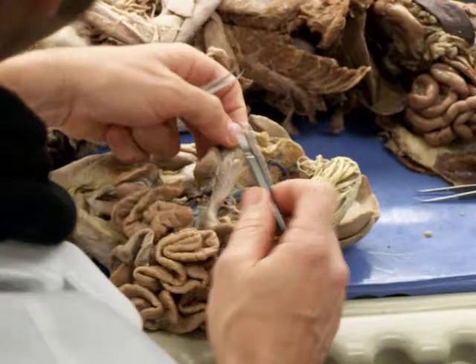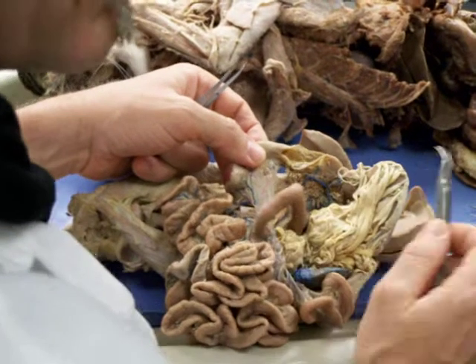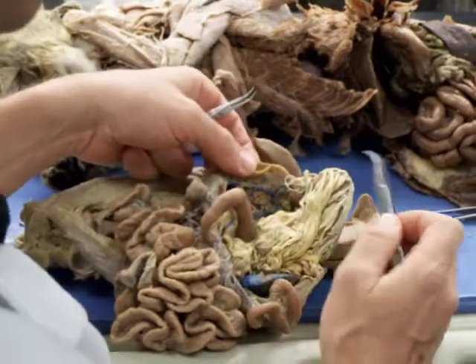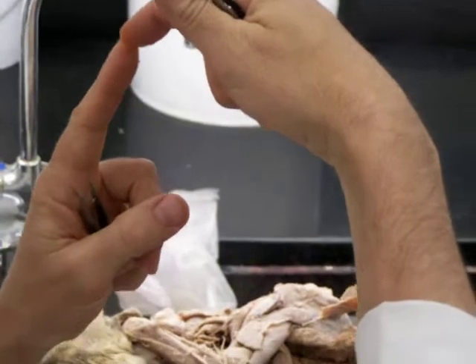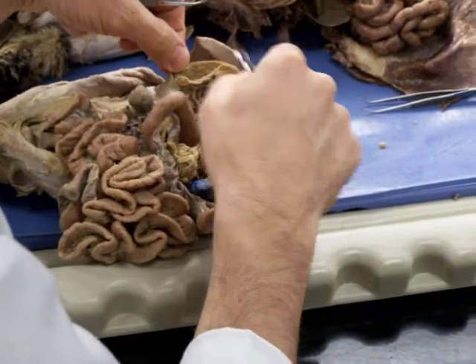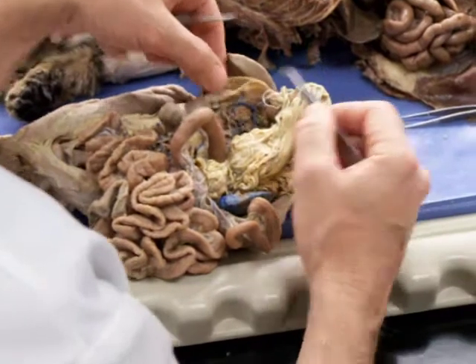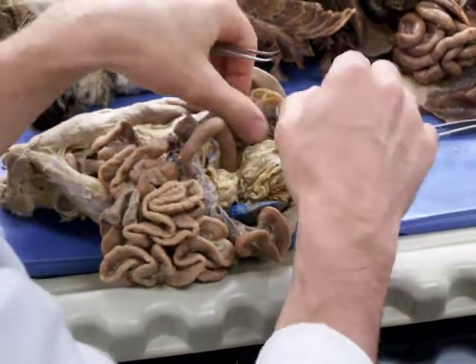There's another one that comes into the duodenum back here, and I'll get to that in a moment. That's the caudal pancreaticoduodenal. And those anastomose right up here in the duodenum. So you have both those arteries supplying blood to that part of the small intestine, which is where there's going to be a lot of digestion and absorption occurring, and it's really muscular. And so the branches of the hepatic then kind of terminate there.